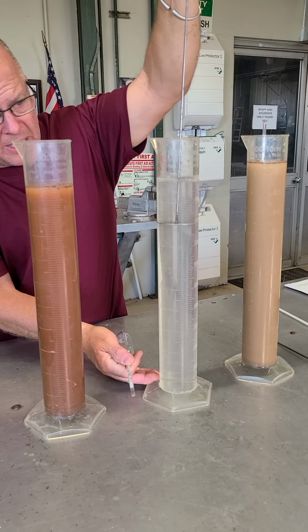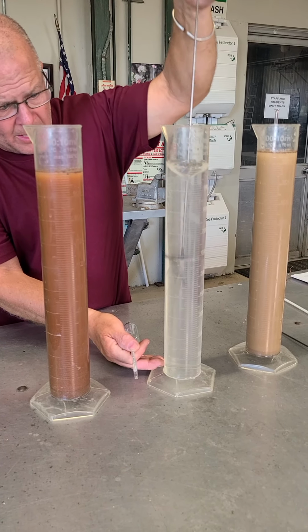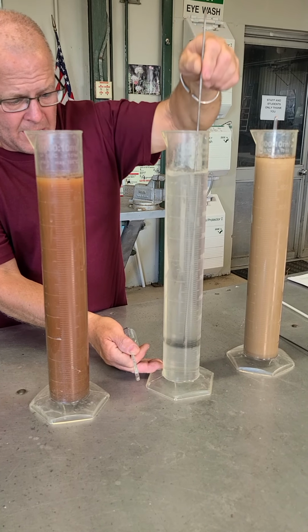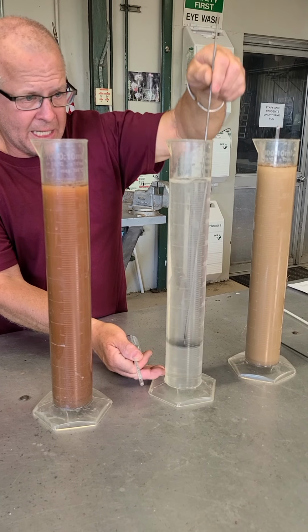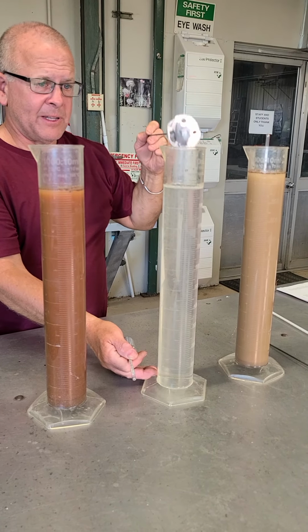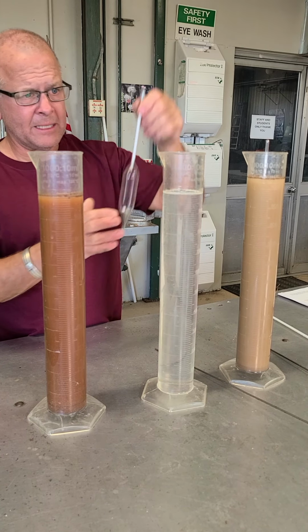Now you can see there's nothing in here but solution. But we're just going to make sure that we do the same thing. So here we go. It's going to be 40 seconds here. It's going to be the top of the hour in just a second. I'm going to pull that one out right there at the 00. Tap this thing off to make sure I get whatever's stuck on there back in solution.